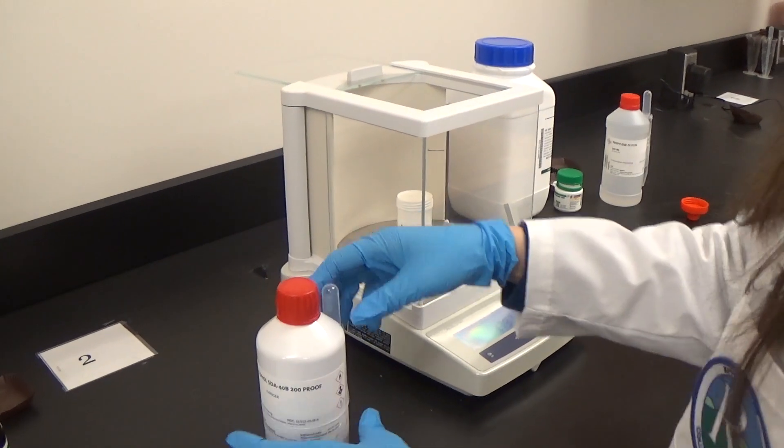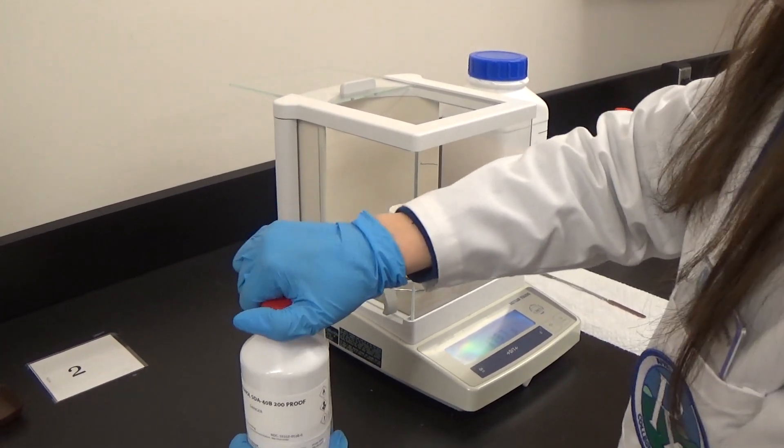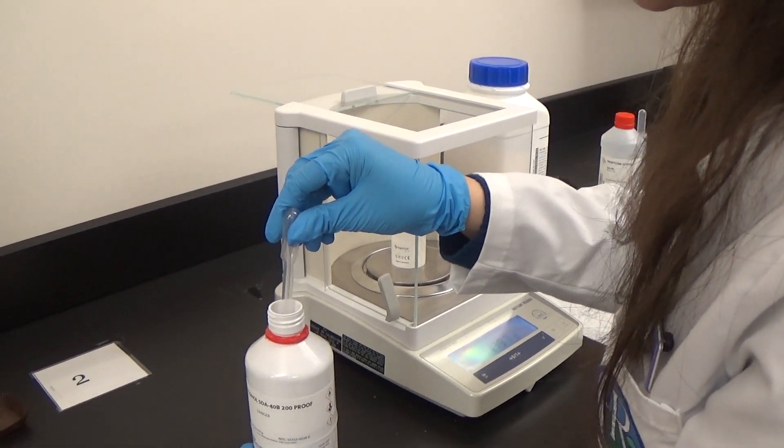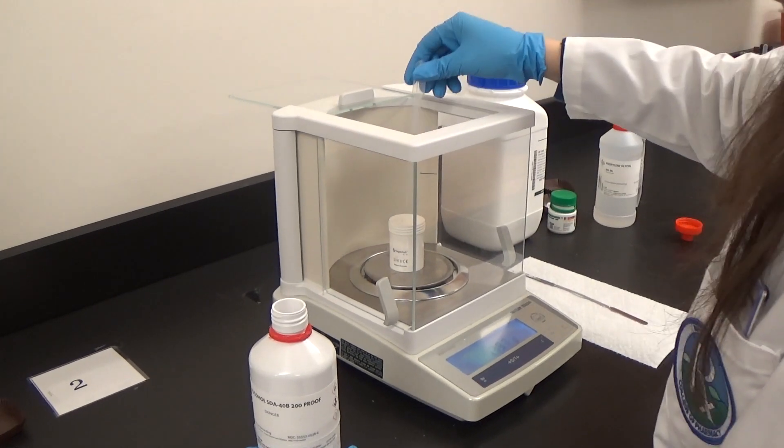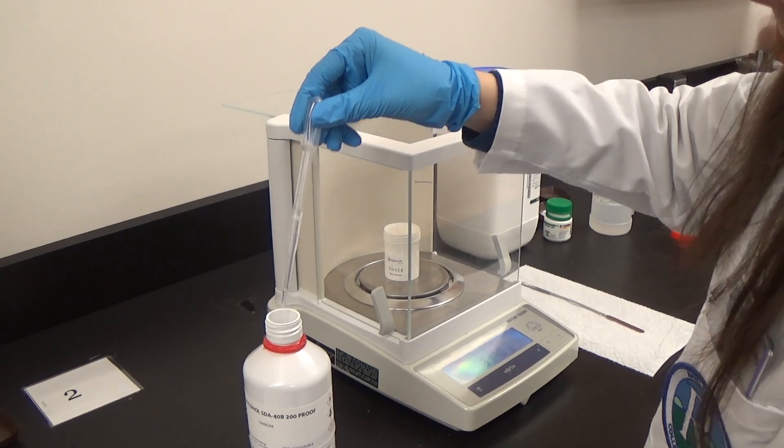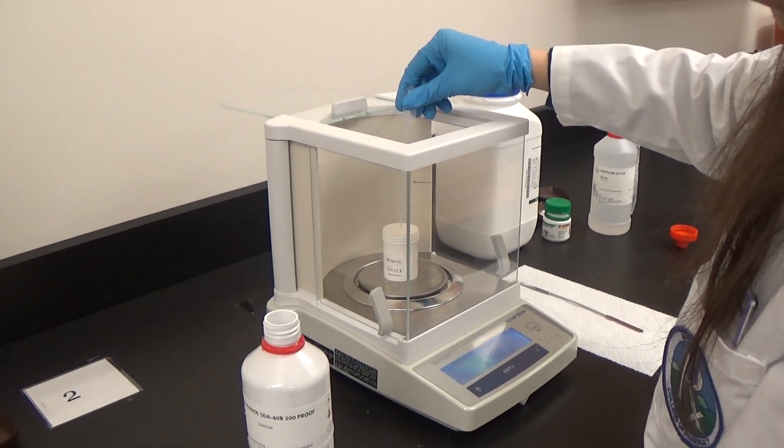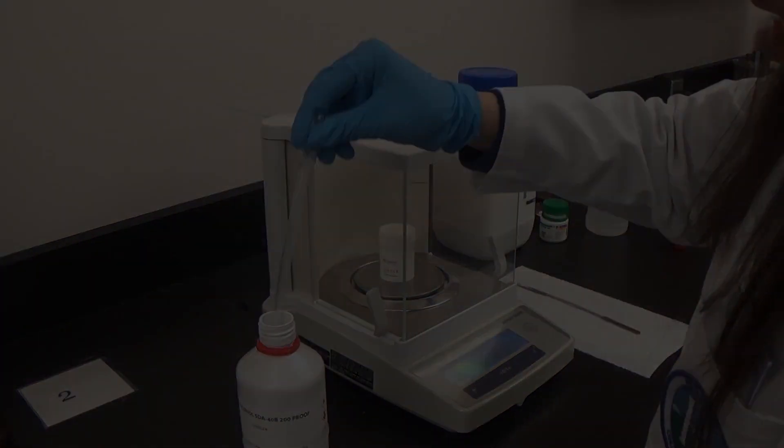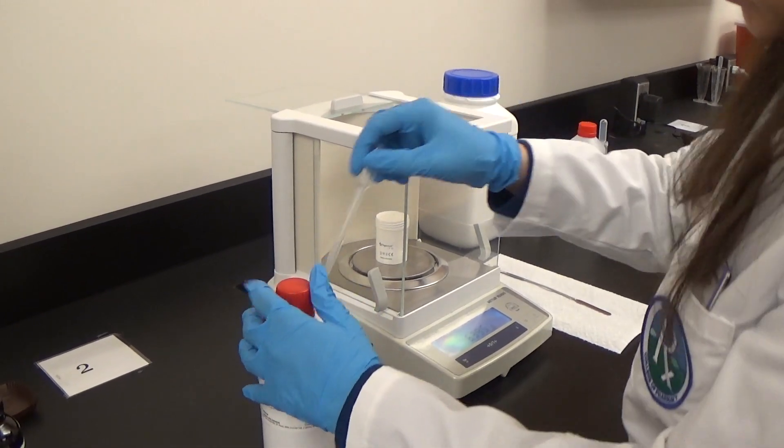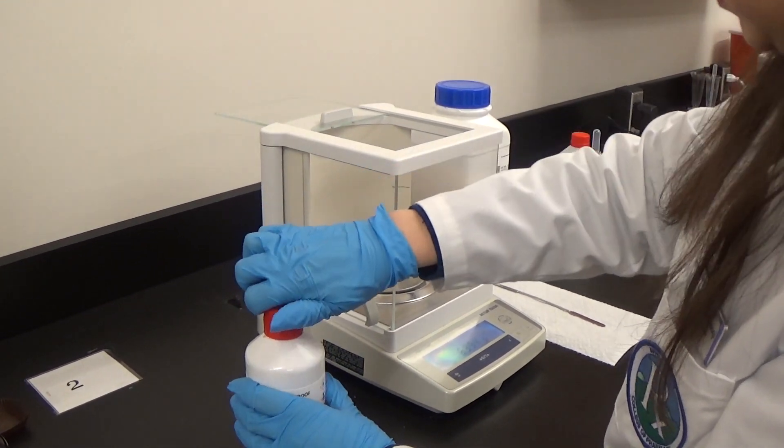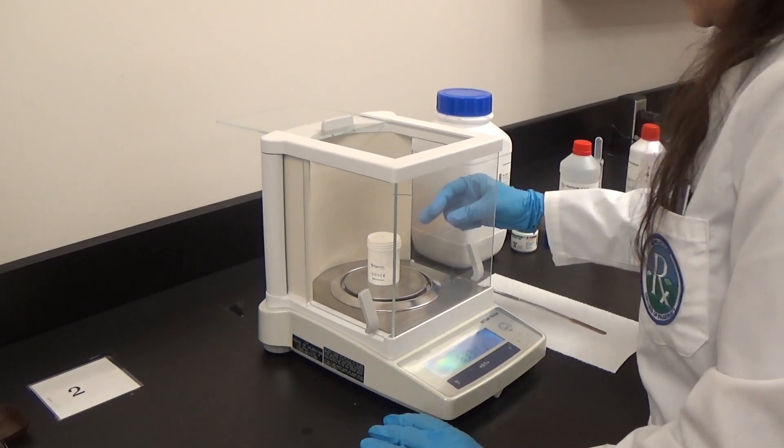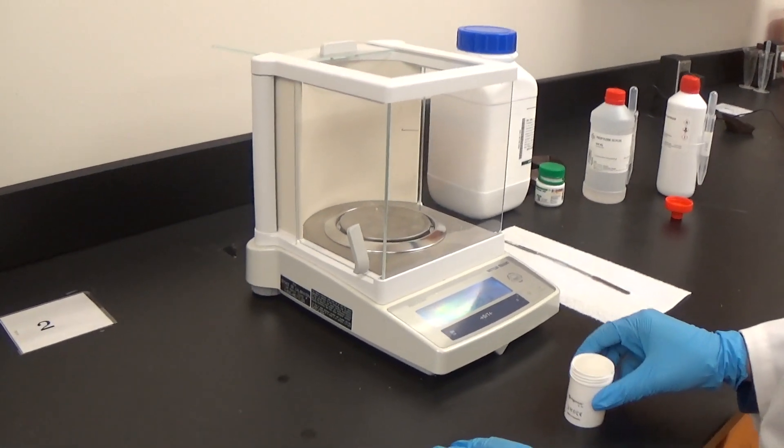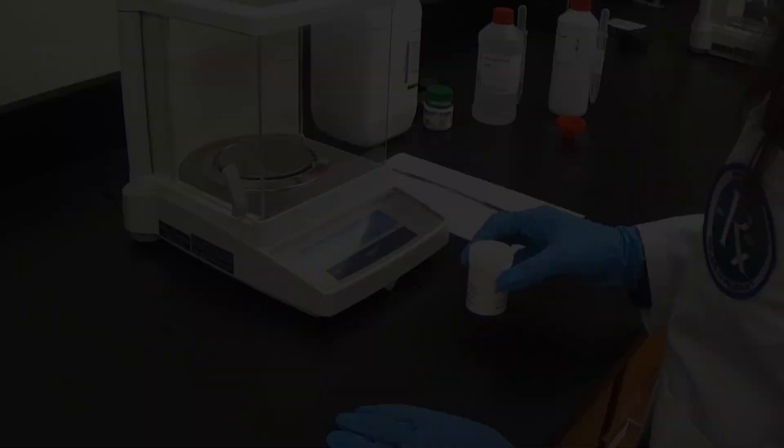Then, we'll add alcohol to the dispensing container using a pipette. After adding the alcohol, swirl the mixture gently for one minute to dissolve the drug.